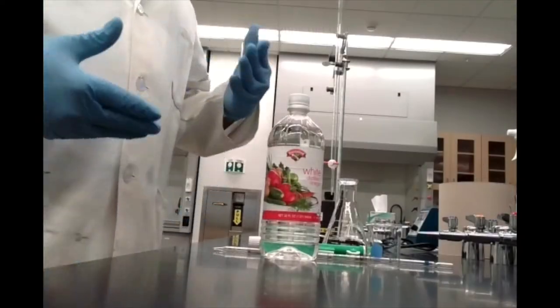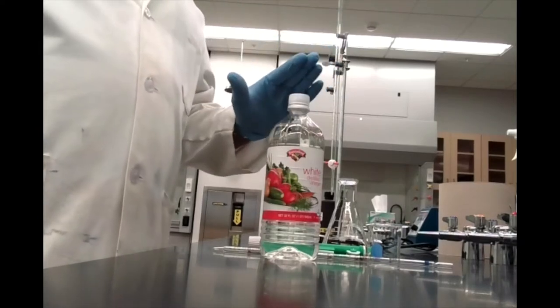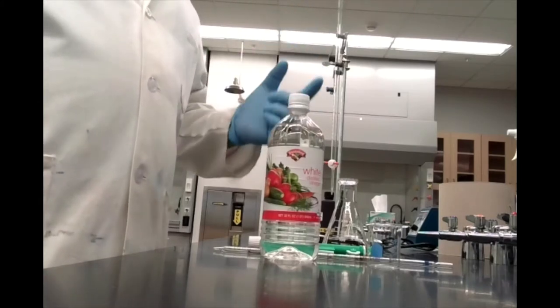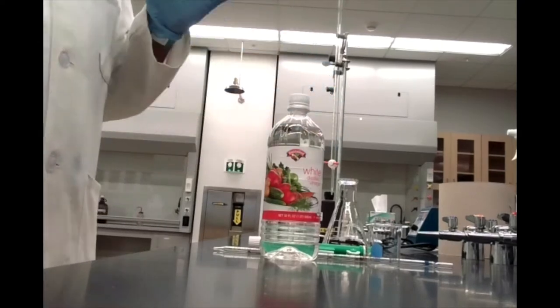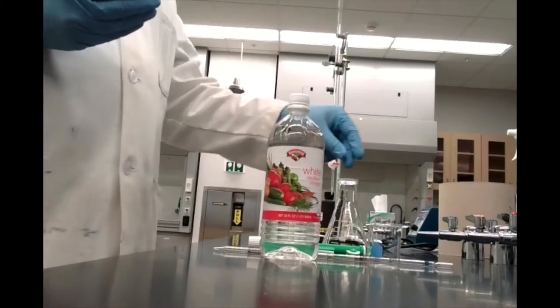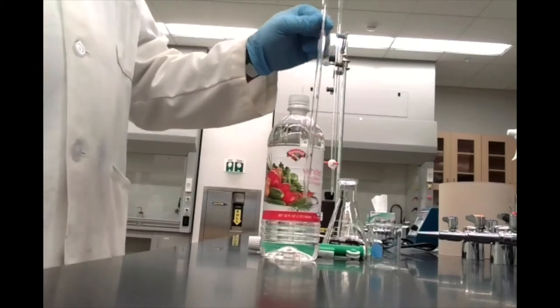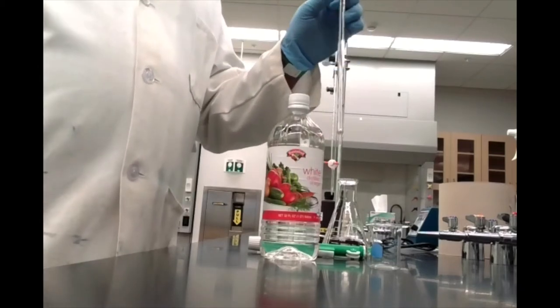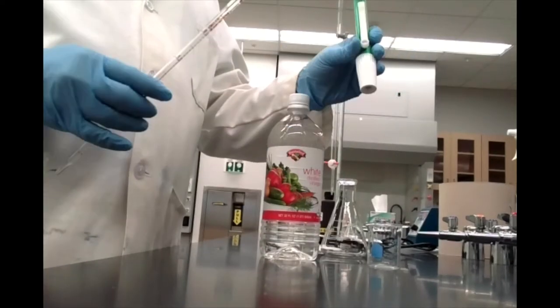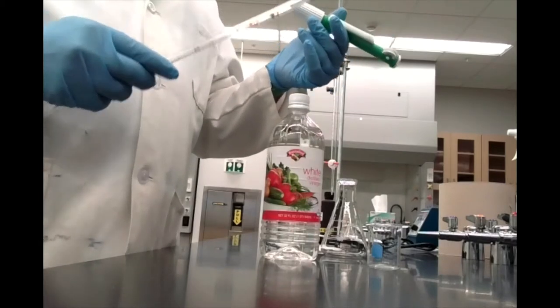In order to carry out these calculations, since we don't know the concentration of vinegar, we need to be careful about measuring its volume — that's going to be very important for trusting our calculations. We need to measure out five milliliters of vinegar, and we're going to be very accurate by using a pipette and a pipette bulb, which allow us to measure volumes very precisely and accurately.